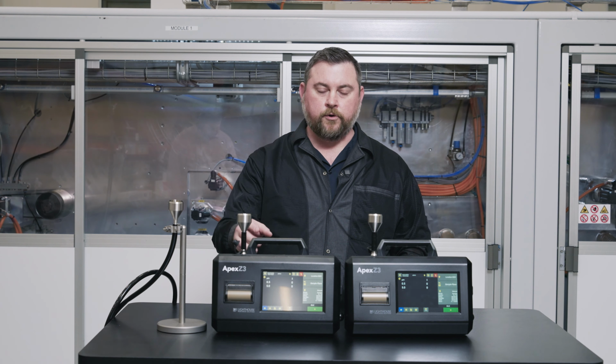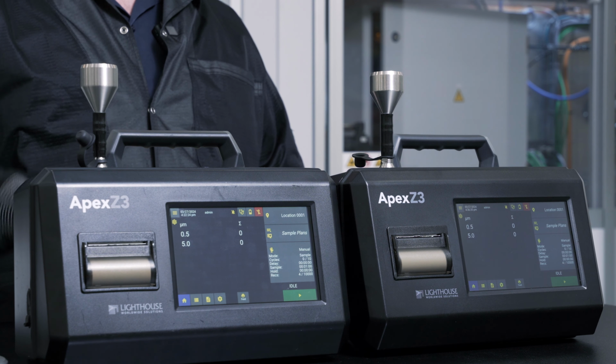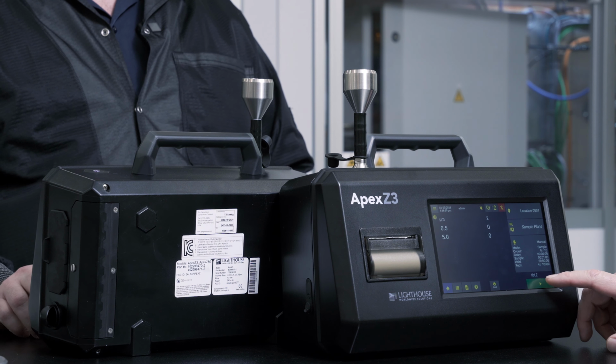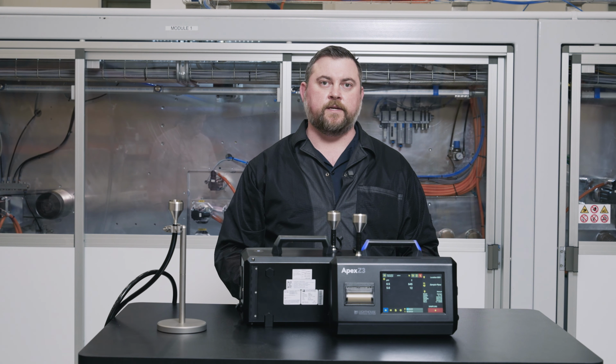And we're going to orient the samplers so that the tubes are as close together as possible, and we're going to start them at the same time. So I could use a volunteer. All right, on 3, 1, 2, 3. And we're going to let these run for 10 minutes, and we're going to take the average of the samples that it collects over the 10-minute period.